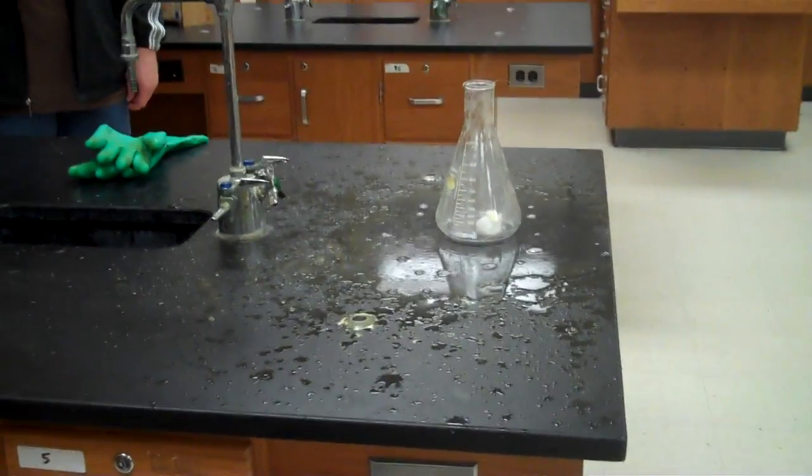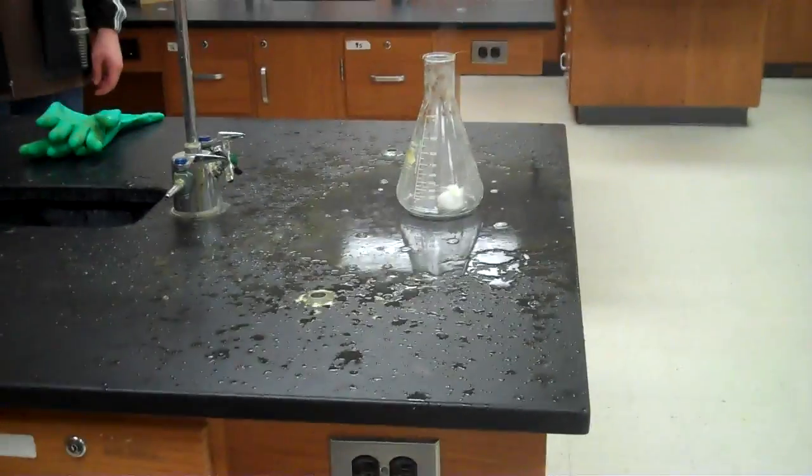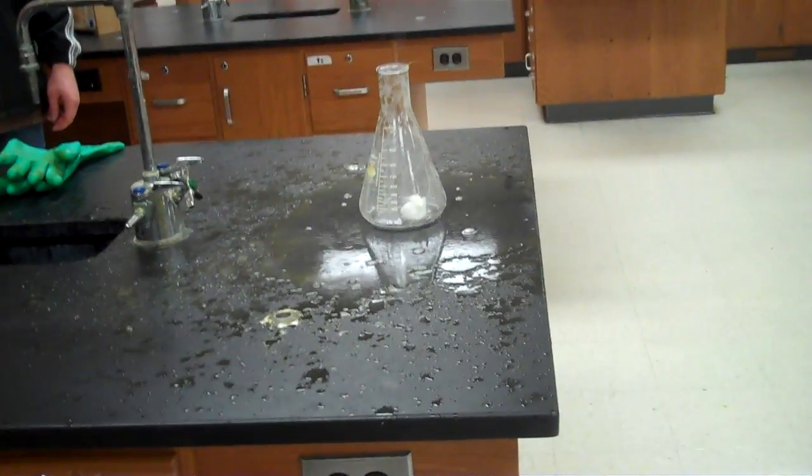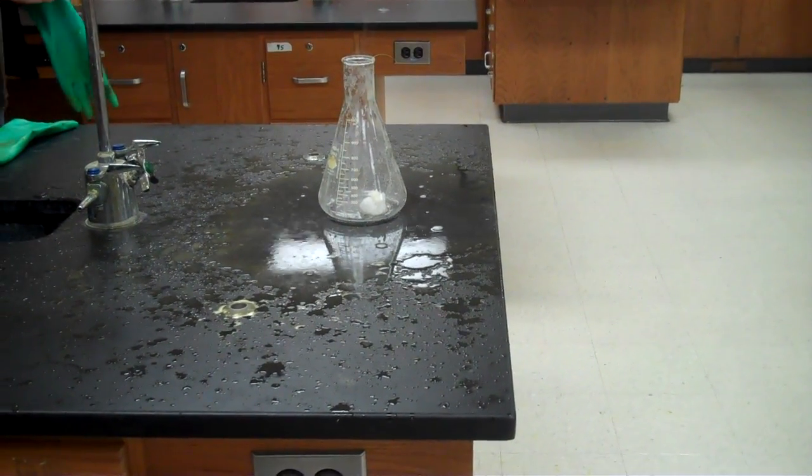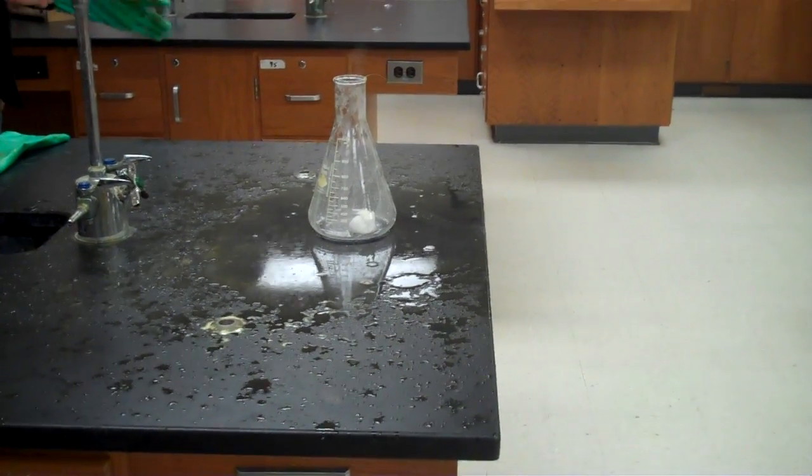In that nice, exploding Aladdin's lamp, we made some water, some oxygen gas, as you can see, and a lot of iodide ions that are on the ground now, and all yellow and such.